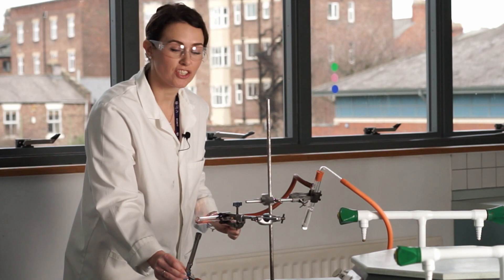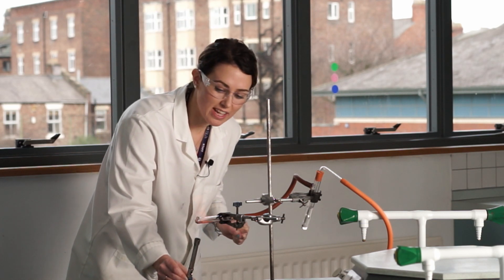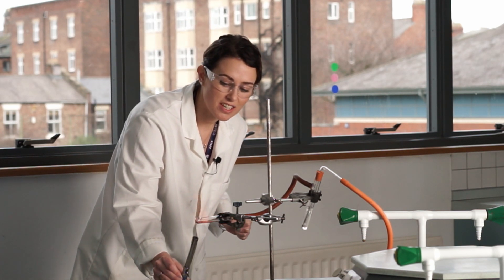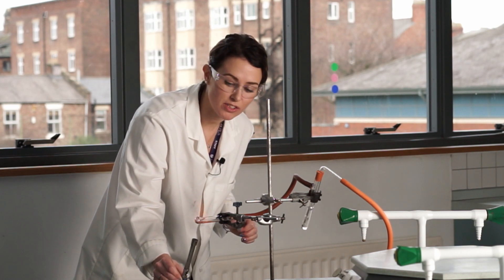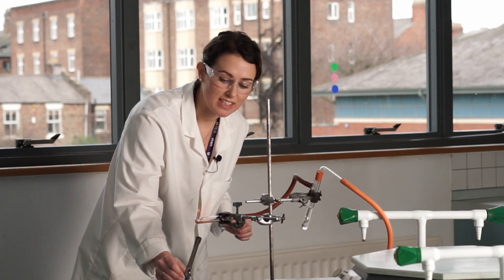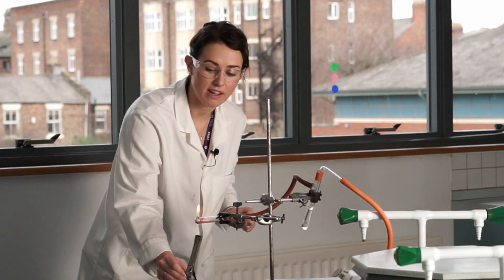So I think that is actually going to be as good as we're going to get with this. There's a little bit of copper oxide at the end that I'm not satisfied has been fully reduced. But without disconnecting this and giving it a good shuffle round, I'm not sure I'm going to get it right now. So I'm just going to talk through how we would stop this practical.